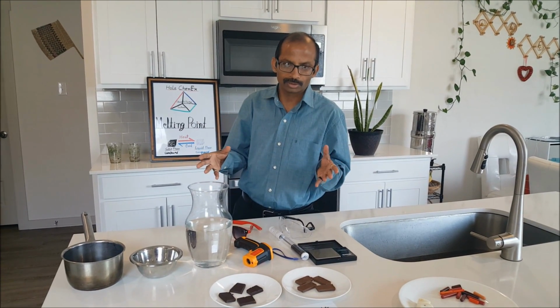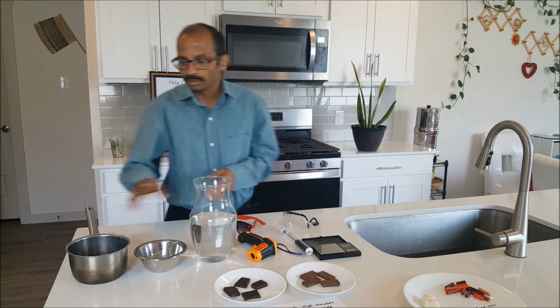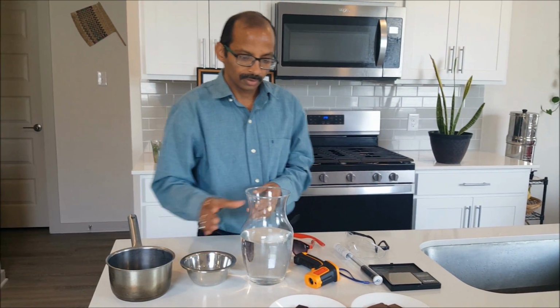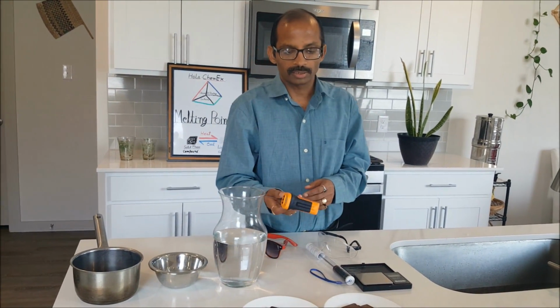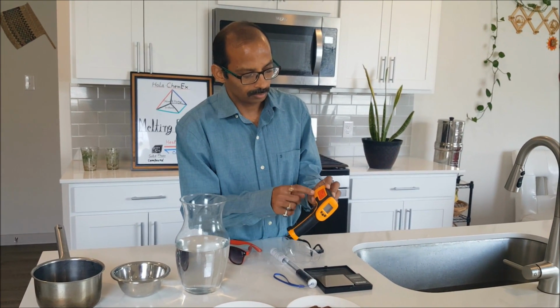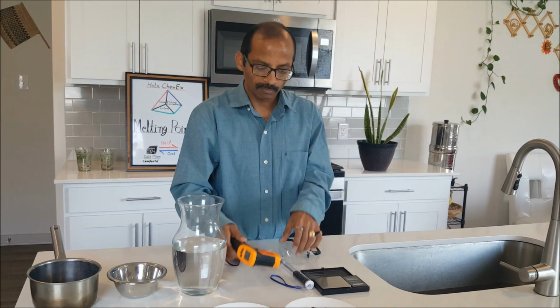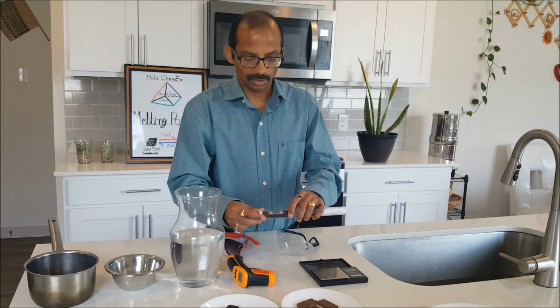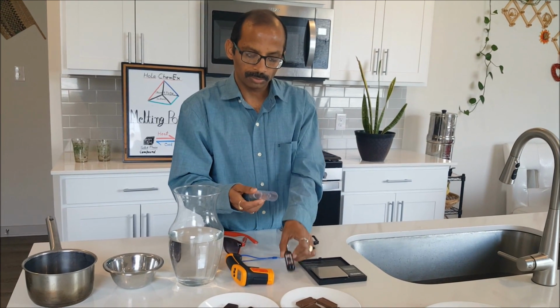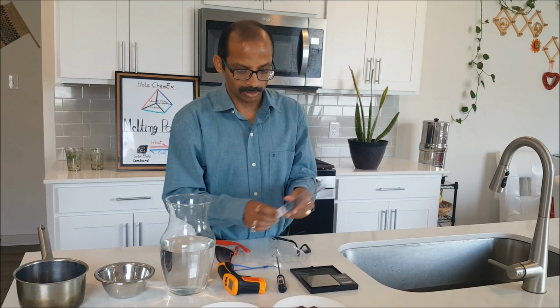So are we ready to start our experiment? Let's review first the materials required here. I need one pan, a couple of bowls, some water, and these thermometers. This is the infrared thermometer, which can measure minus 23 degrees Celsius to 550 degrees Celsius. When I bought this one, these two came together, so I am going to use them together. This thermometer has a measurement capacity of minus 50 to plus 300 degrees Celsius.